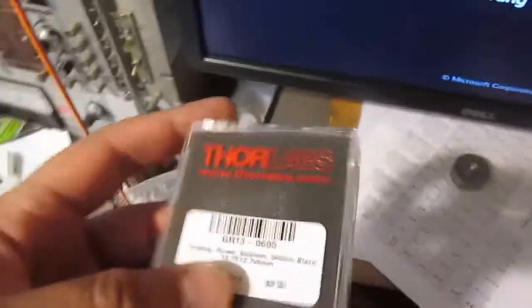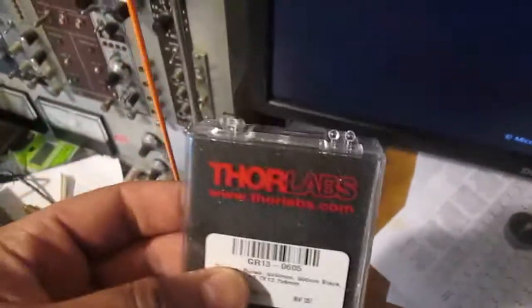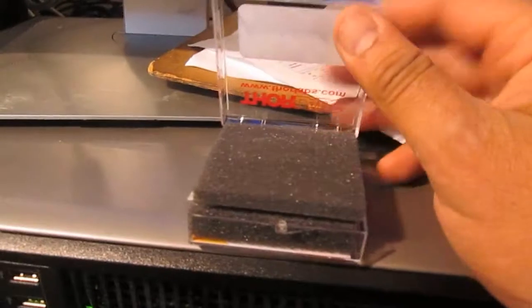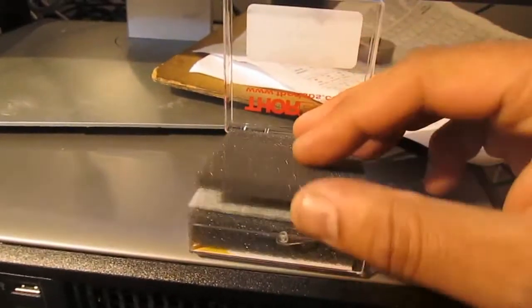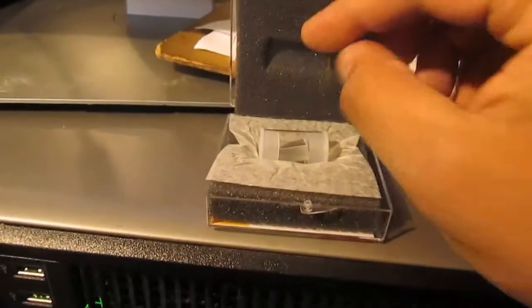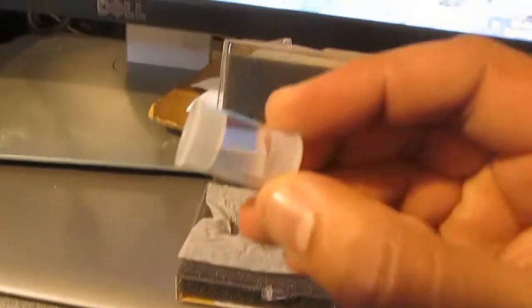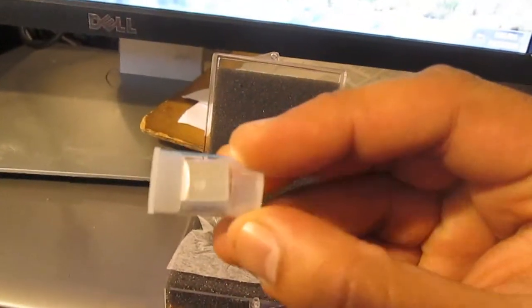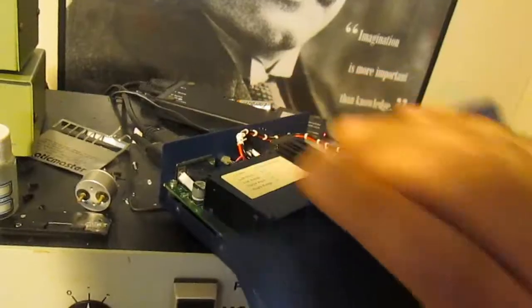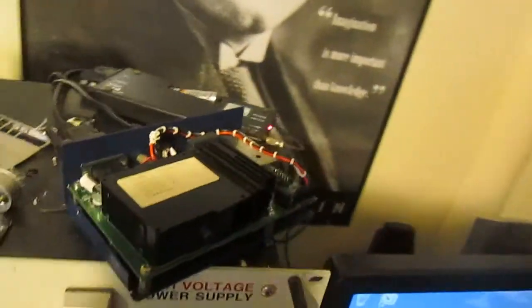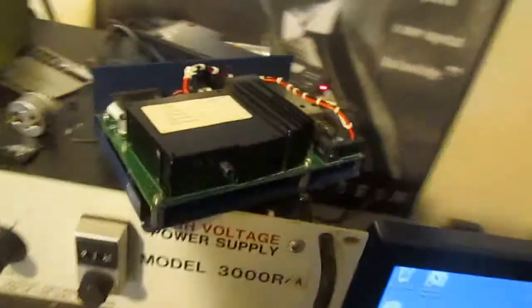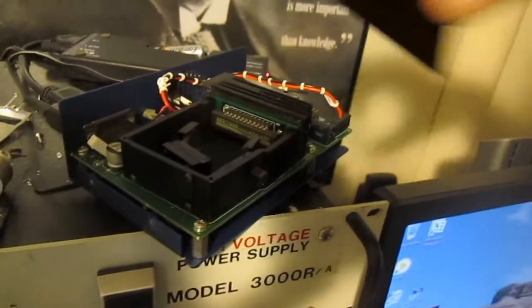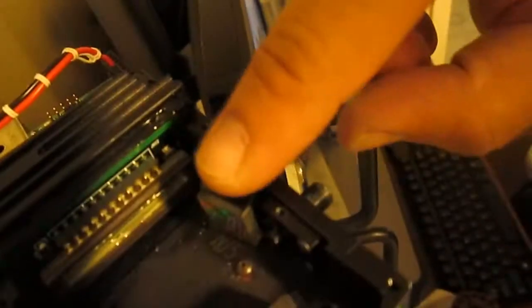So I'll change the grating on my spectrometer. This is a 600 line per millimeter grating, it's made by Thorlabs. They were super nice and shipped very fast. They even included a bunch of treats and candies along with the grating. Anyway, we should see a broader spectrum and lose a little bit in the resolution, but I think it's okay. We really wanted to see a broader spectrum.